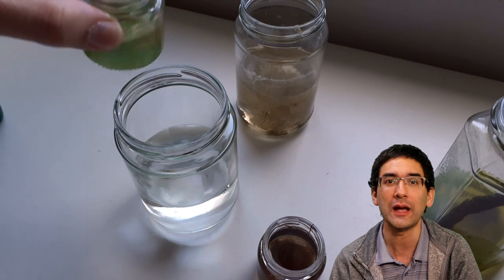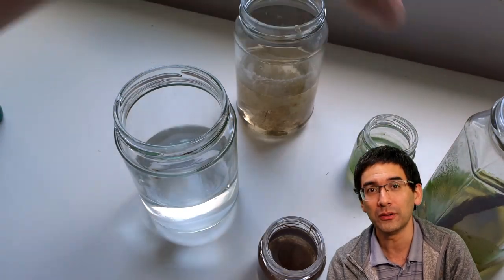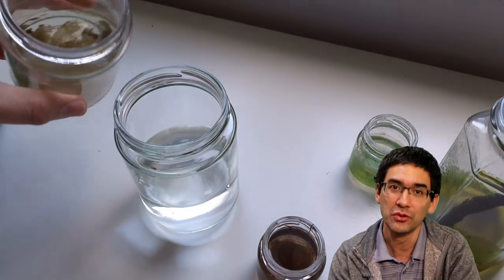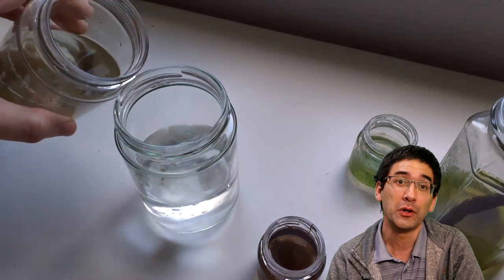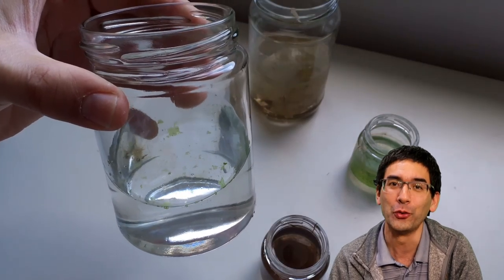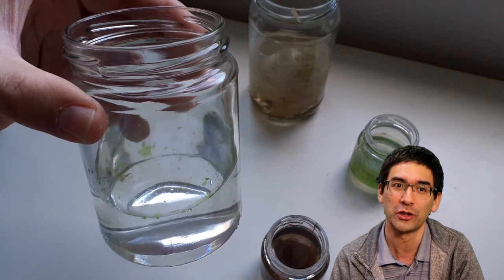Then you need to inoculate the culture. This means that you have to add some water or some algae to the water, because otherwise the algae are not going to start growing just on their own. You need to have something like a starter culture.